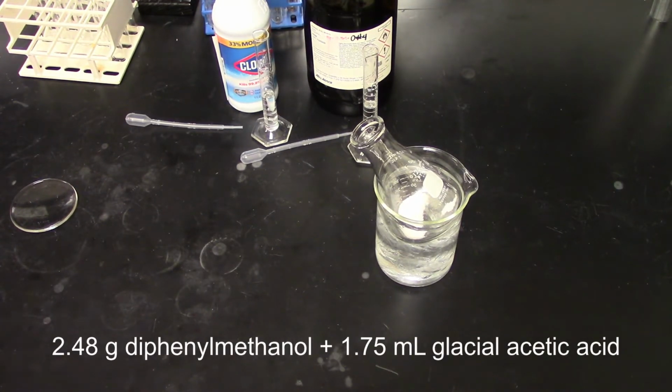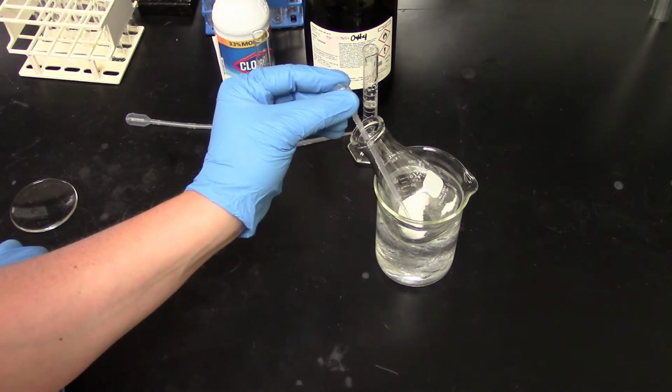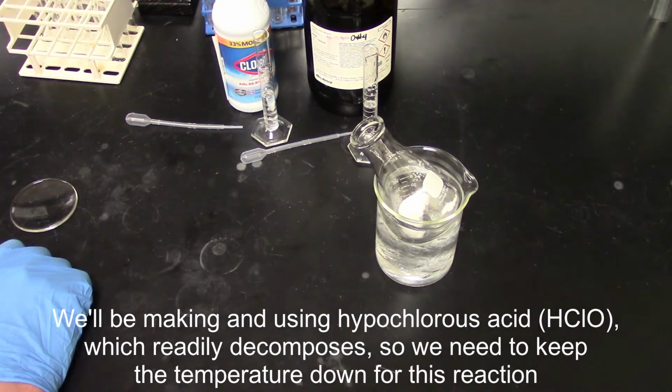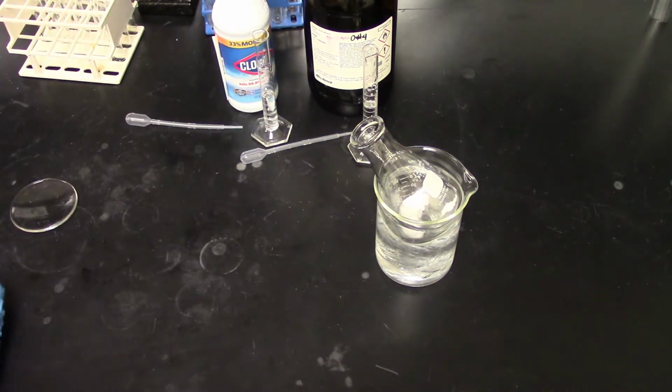Now I'm going to use a disposable pipette here, and generally you want to use something a lot more precise than that, but this is just a demo video. We're going to add this in slowly. The glacial acetic acid is going to release a lot of heat as it begins to dissolve, so we want to make sure we don't add it too fast, or it might affect our product. So we're going to add in an ice bath.